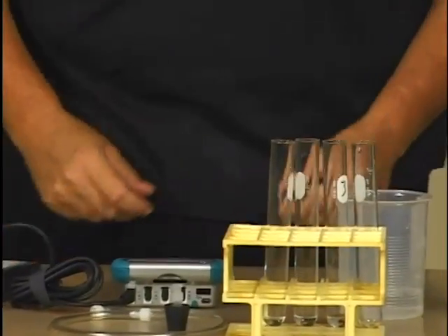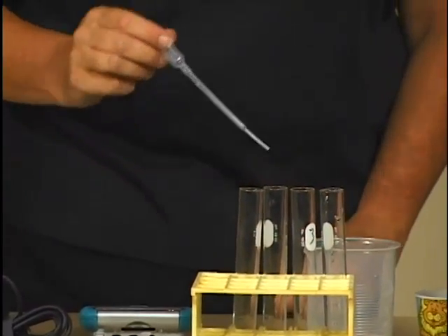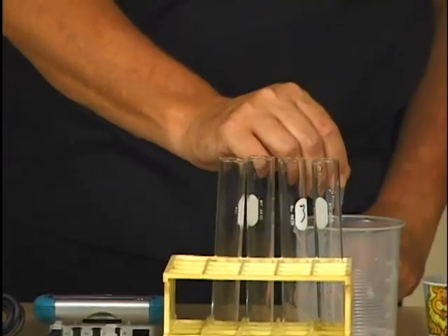The enzyme catalase will be investigated at different concentrations. Add three milliliters of water to each of the four test tubes in your test tube rack.